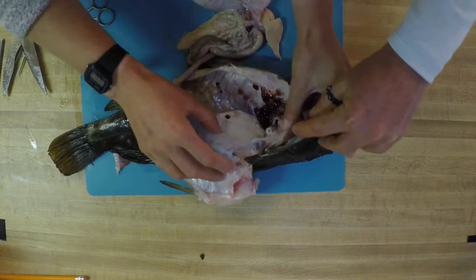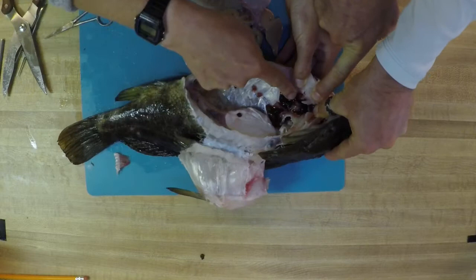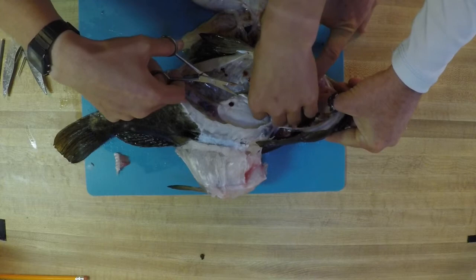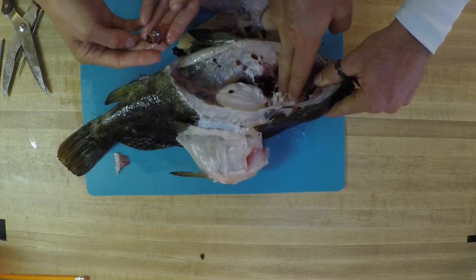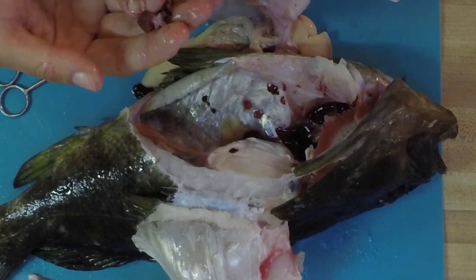What do you think that is right there, in that little area just underneath? That is normally where we'd find our heart. We're going to take some small scissors and actually pull that heart out. While I'm cutting this away, can you explain the red stuff around the heart? Fish, just like humans, also have a set of paired kidneys as well. Some fish like this one will have kidneys a little bit farther up towards the top of their head, just behind that swim bladder we talked about earlier. So this is one of them that you're seeing right here, and the other one is tucked away underneath. Are fish hearts very similar to human hearts? They are — they have multiple chambers just like we do, and they're helping to pump that oxygenated blood out through that fish's body.